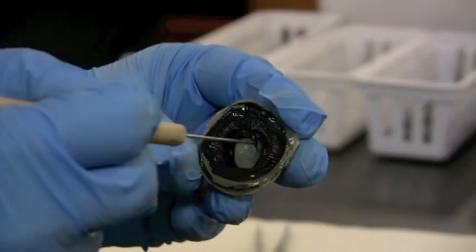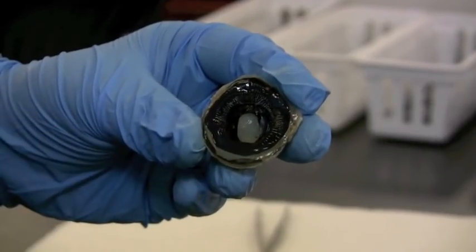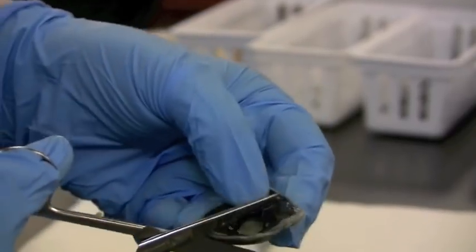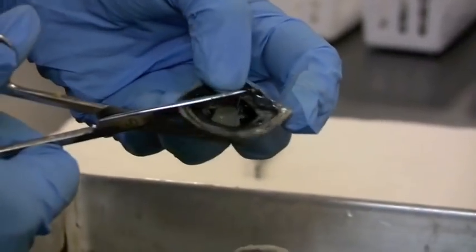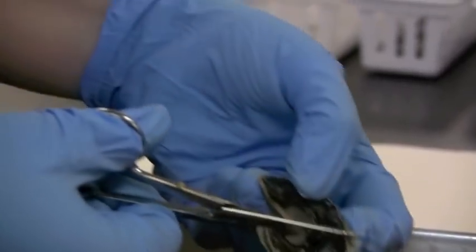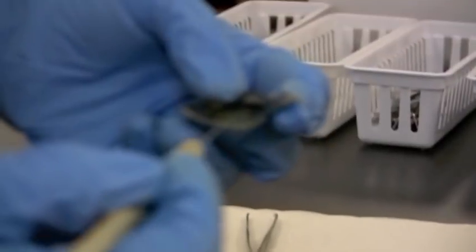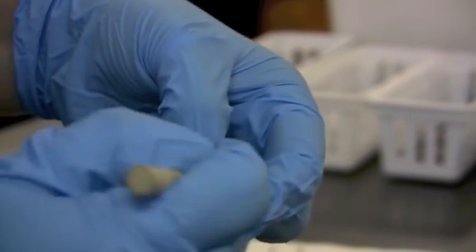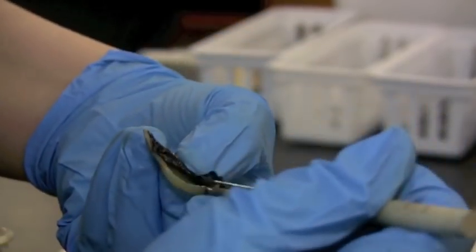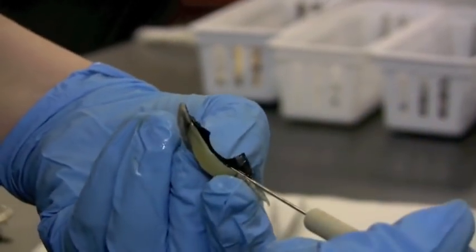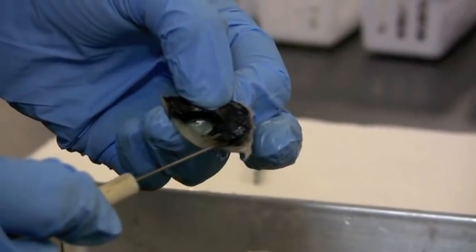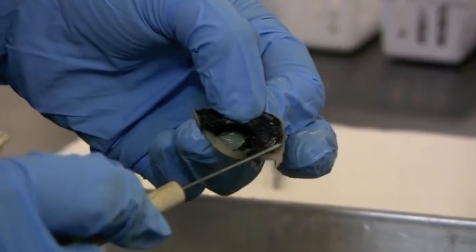I'm going to go ahead and cut across so we can see in front. So I'm going to kind of pull that apart a little bit as we peel back. So I've cut through and around the iris and the ciliary body here.